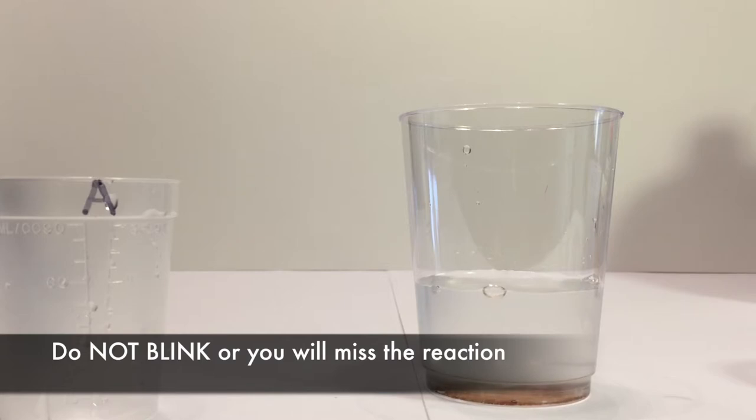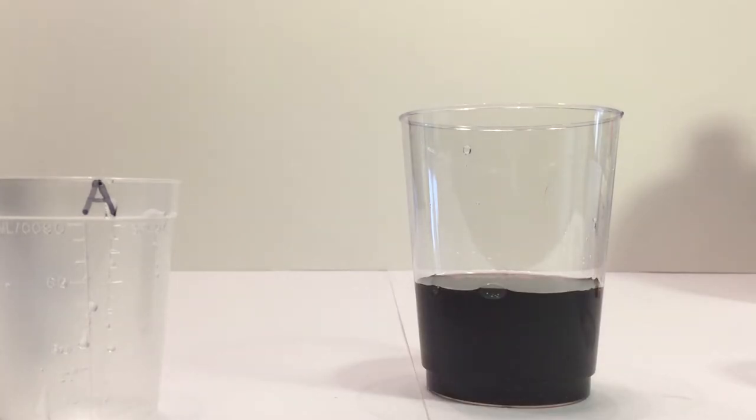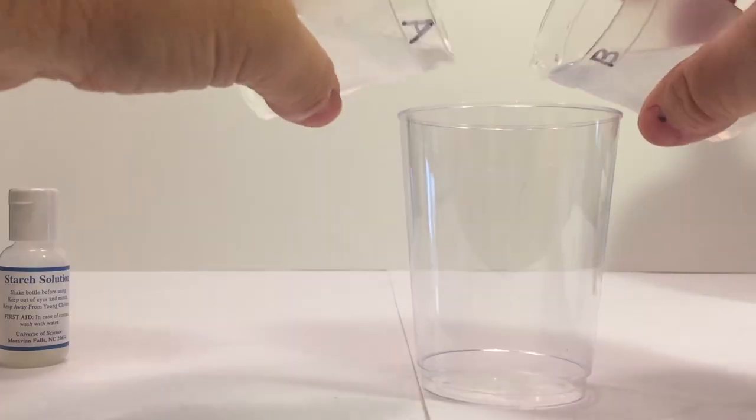So we're coming close to about 10 seconds. And we're getting really close. Five, eleven, boom, there it goes. Beautiful. All right.